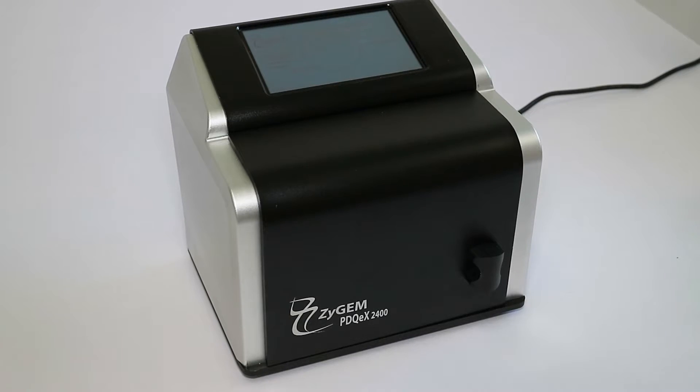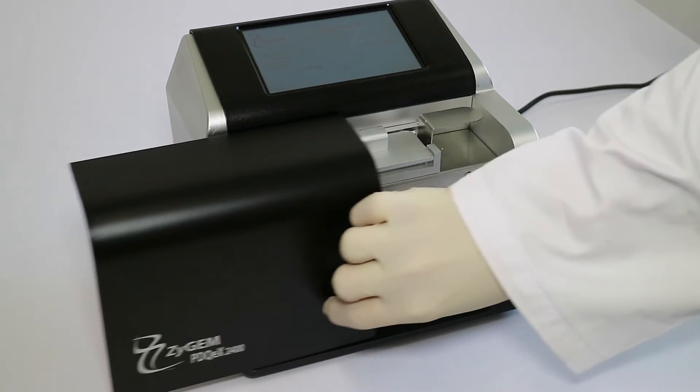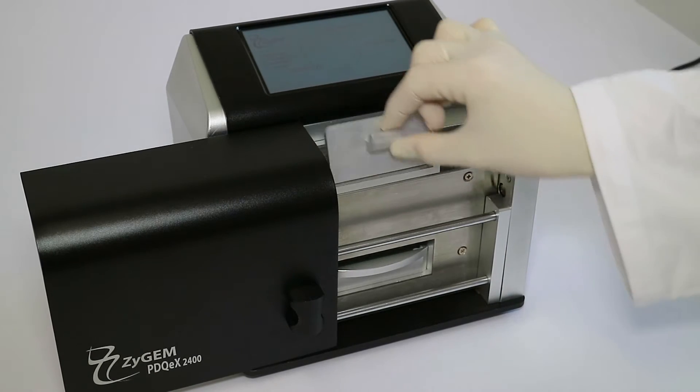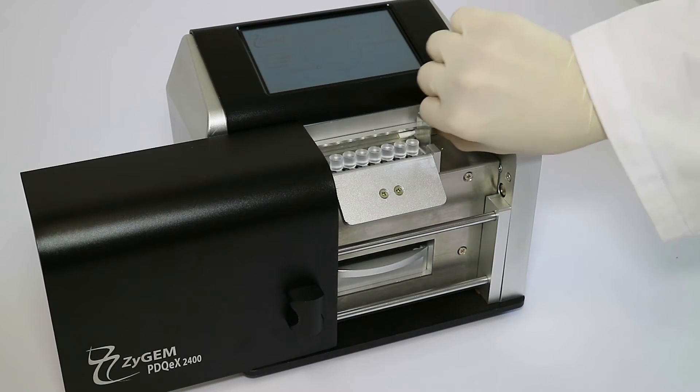When the program ends, the front door will unlock. The tubes are removed and discarded and the extraction is in the collection tubes.